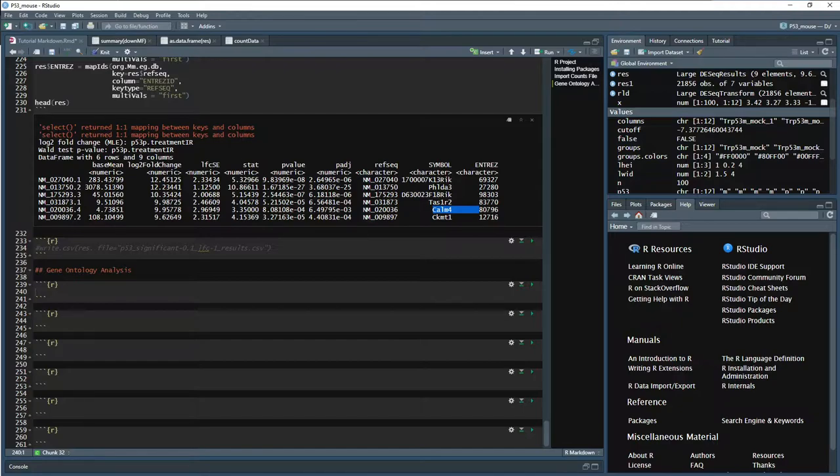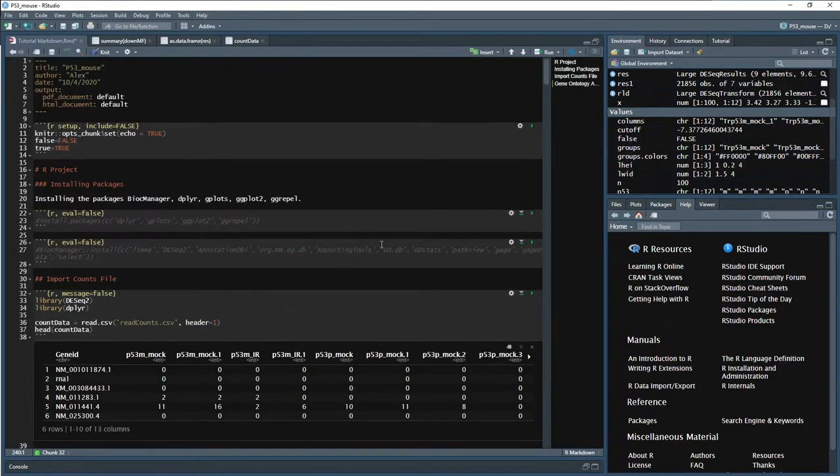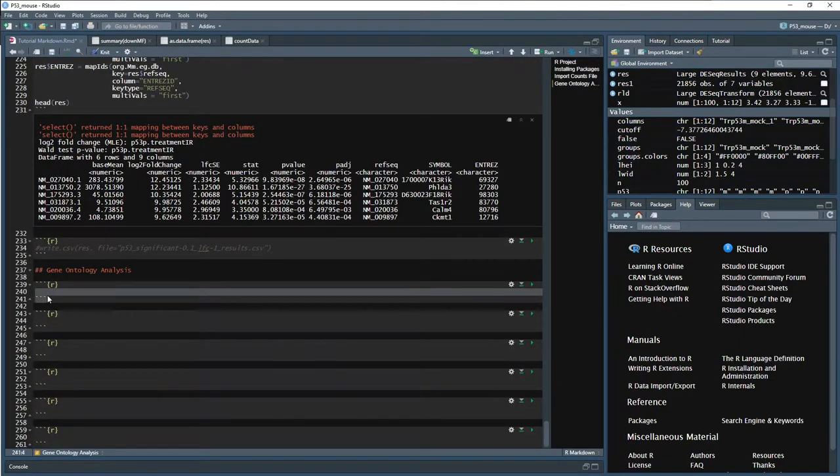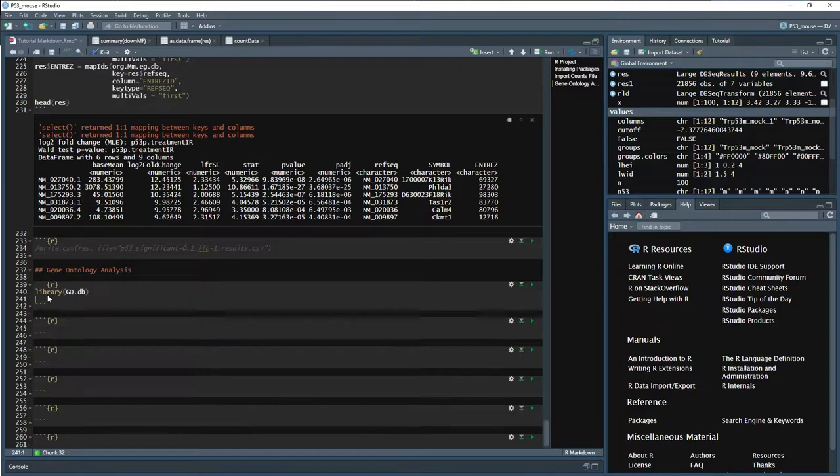So first, to get started with this, we need to import two packages that we had installed when we were setting up our R environment, and that is our GOdb and GOstats. So if you come back down, we can go ahead and import those with library GOdb and library GOstats. And then Control Shift Enter. We'll run the whole block, and then we have them imported.